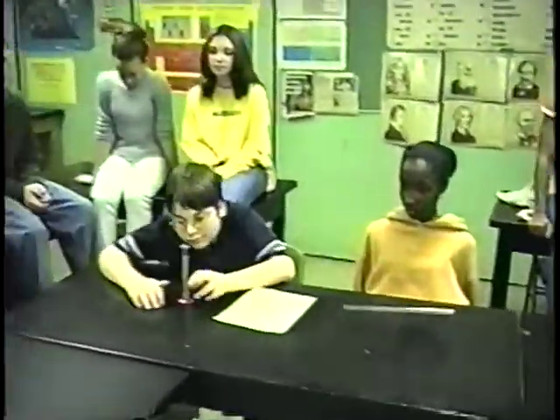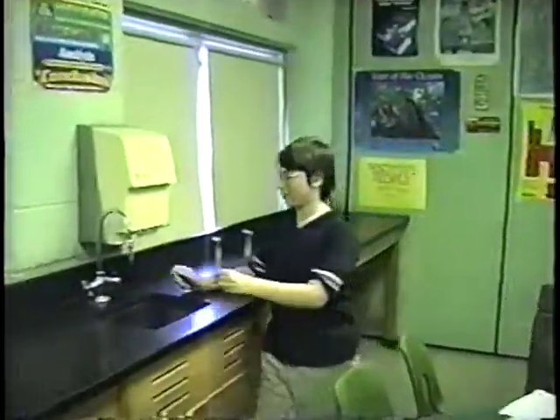And what metric unit does it measure volume in? That particular cylinder, when you have liquid in it, it's what? Liters? No, liters are much too big. Milliliters? Milliliters, okay? So, David, what we want you to do right now is to get up and go over to that sink and put any amount of liquid that you want into it, and we'll follow you over there to see your technique and how you put water in.